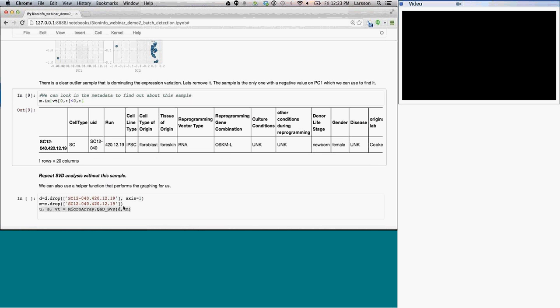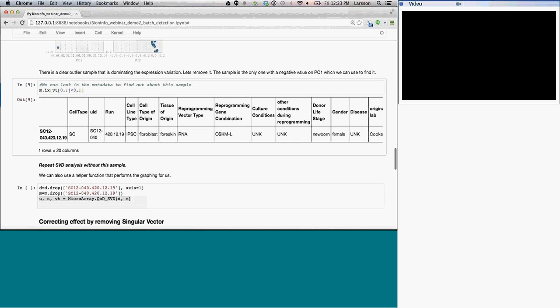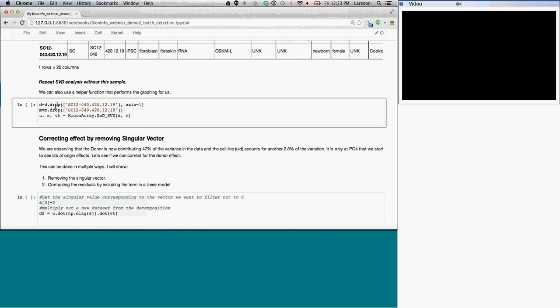So as we move forward, we're actually going to drop this sample. I'm just going to say, take the data that I have, drop the sample, store that, drop the sample from the metadata as well, and then perform a new singular value decomposition. So this is basically where it detected an outlier.